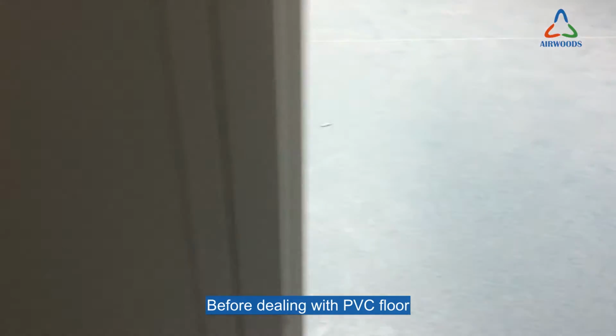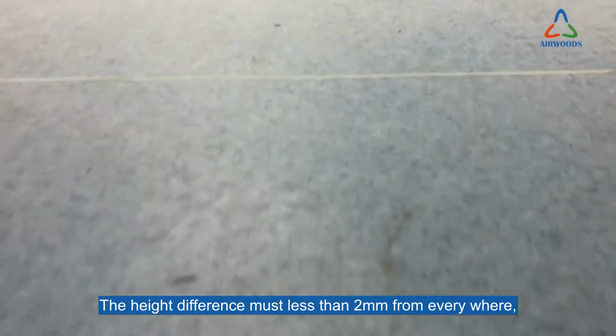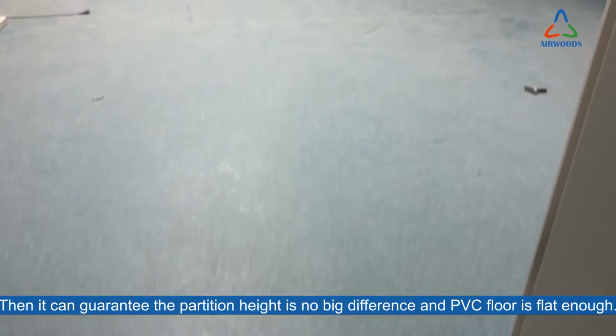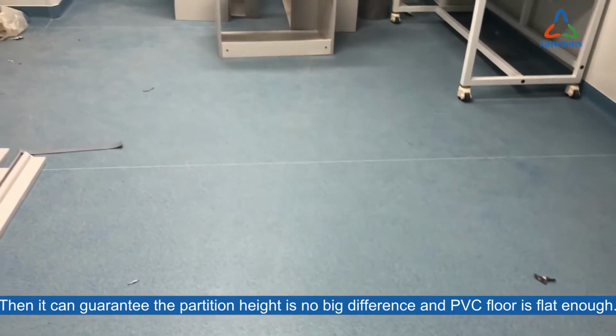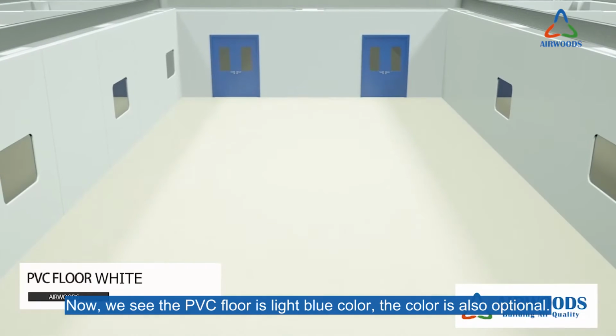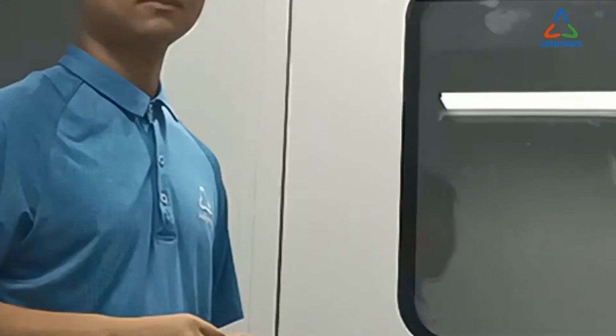Before installing the PVC floor, you have to make sure of the smoothness of the cement floor. The height difference must be less than 2 mm everywhere. Then it can guarantee there is no big difference in the partition height and that the PVC floor is flat enough. Now, we see the PVC floor is light blue. The color is also optional.